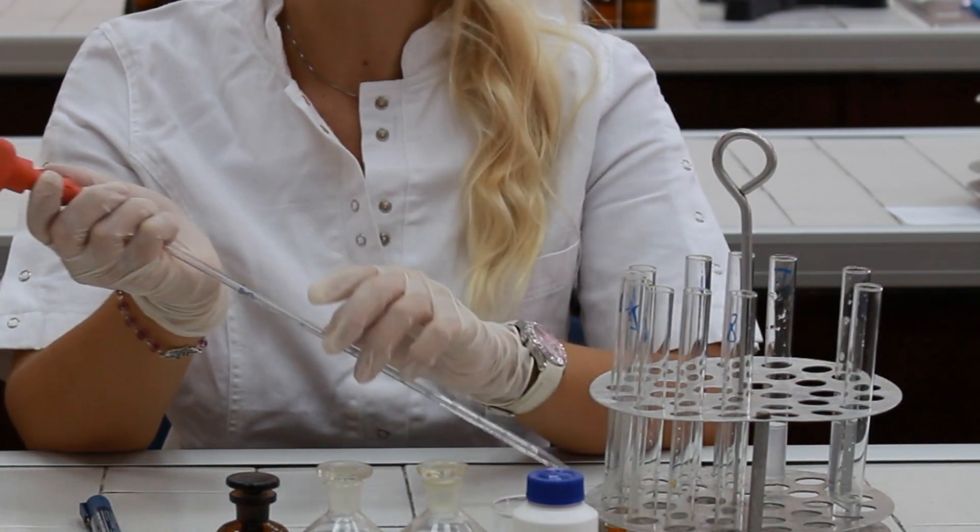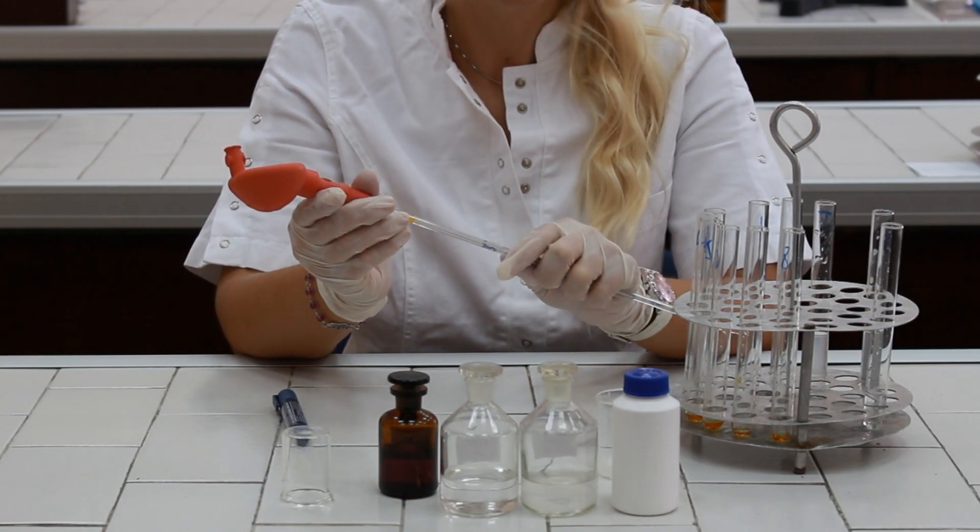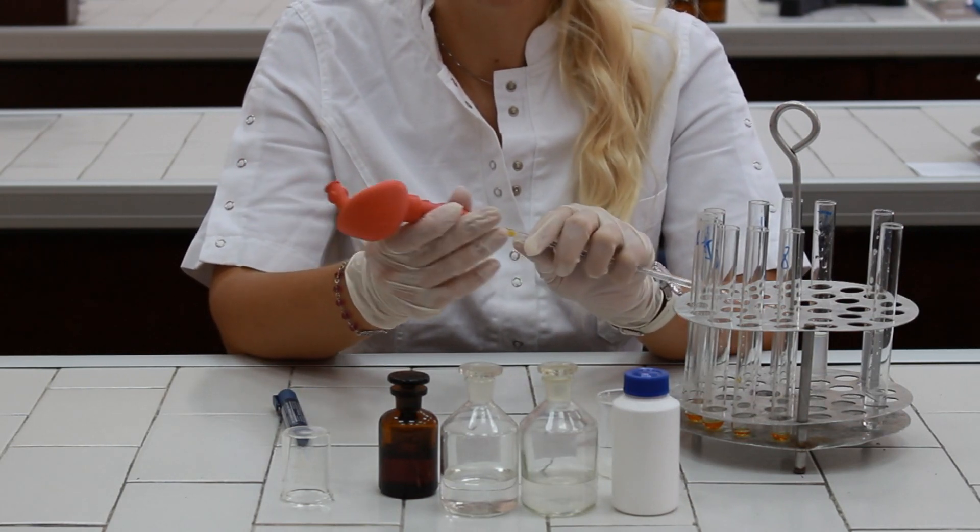Continue the process until the light yellow color is shown in the last test tube.